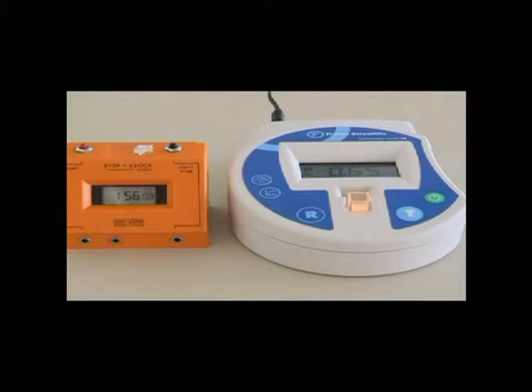The experiment that we've set up here is designed to look at the effect of different concentrations of the enzyme on the initial rate of this reaction. And so we have to repeat what you're seeing now for each concentration of enzyme, get a graph of time against absorbance reading for each concentration of enzyme. From each of those graphs, get the gradient of the straight line portion of the line, which gives the initial rate, and then finally plot those initial rates against enzyme concentration on a final graph.